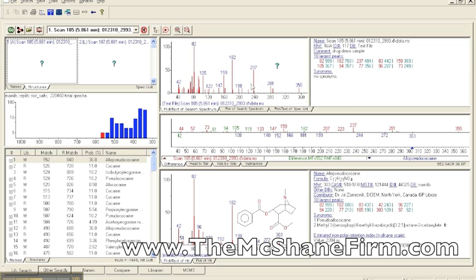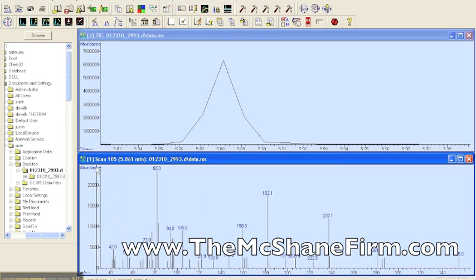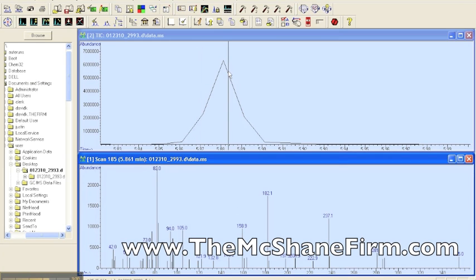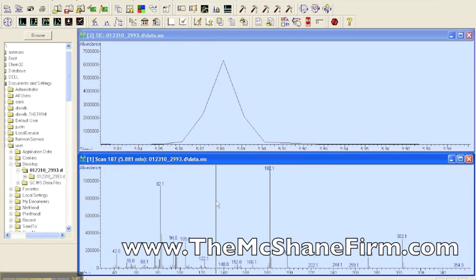That's your spectrum, because you can see it's scaled up to 100 as opposed to our scan, which is just by abundance. What you're doing is comparing this to this, and what it's saying is our top guess here is this allo-pseudo-cocaine. The issue with that is that in some states allo-pseudo-cocaine is not illegal. So if this was a well-resolved peak, it doesn't matter where we right double-click, we should always come up with allo-pseudo-cocaine. So let's choose the highest part of the peak, and then right double-click on it.